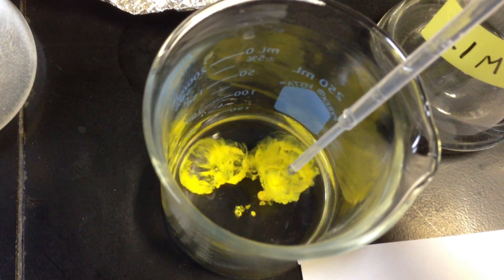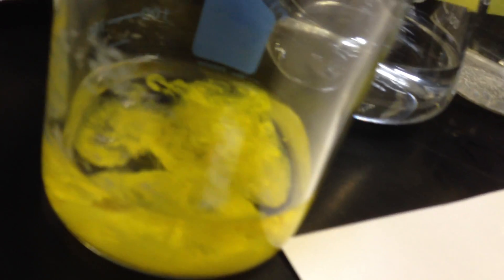So let's take a look. Maybe we'll see a side view here. See if that looks even more fun. So that's a nice, pretty precipitate forming there. Okay?